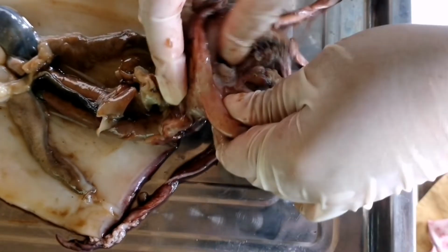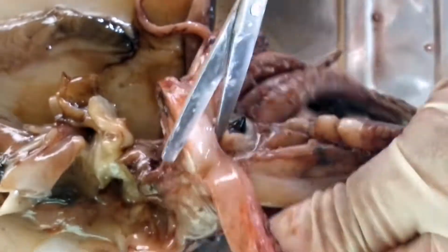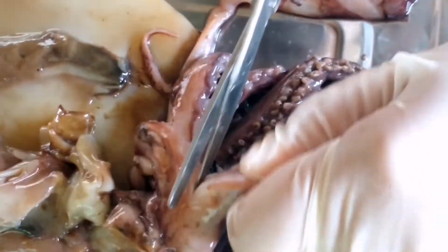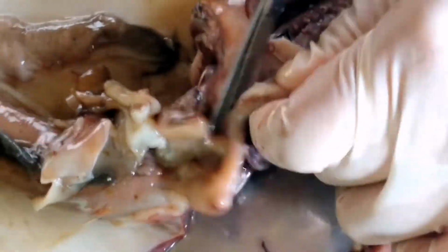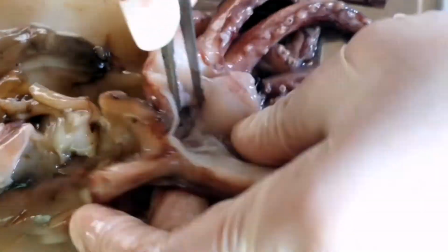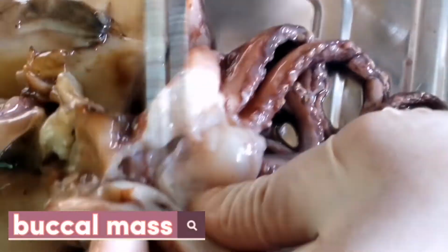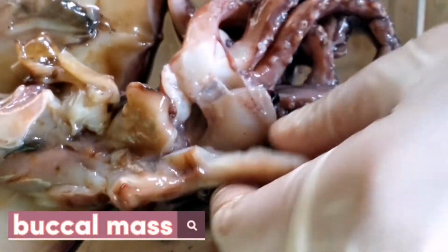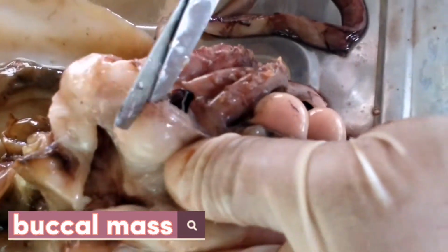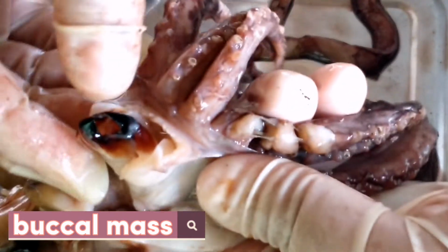And now let's go back to the head of the squid. Now I'll just cut up into the space between the mouth and the arms here. This large ball structure right here is called the buccal mass. This is where the mouth leads into. And cutting into the buccal mass and prying it open, we can see another structure.